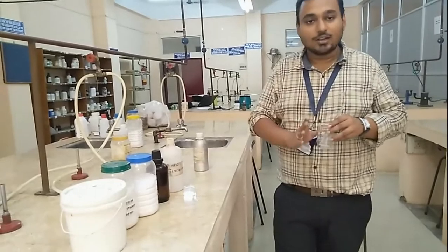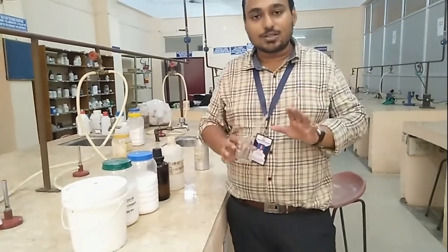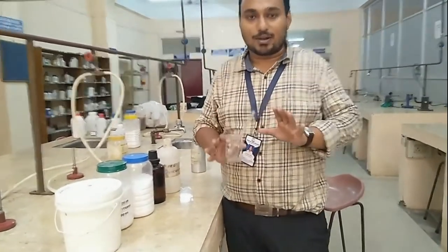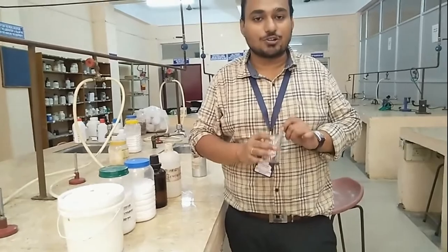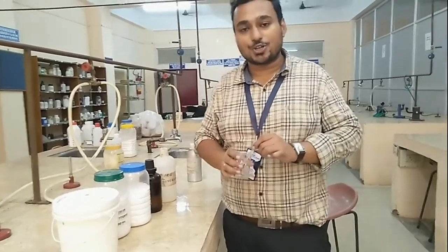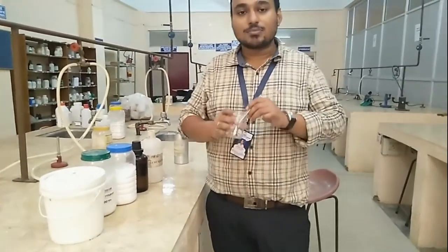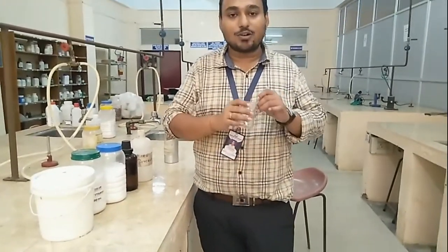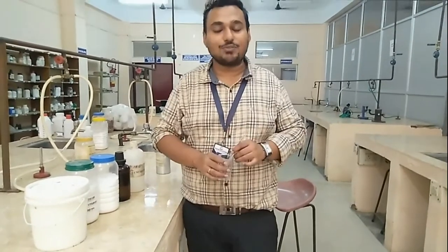After that, we add the perfume to it, and the shampoo sample is prepared. This is the simple procedure for the preparation of shampoo. The next step will be to describe the evaluation of the shampoo sample.